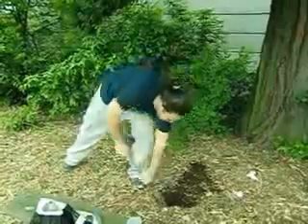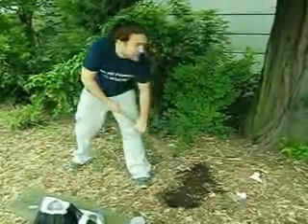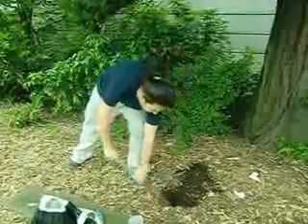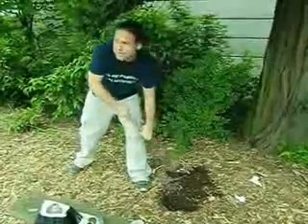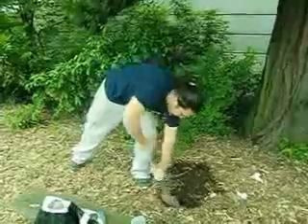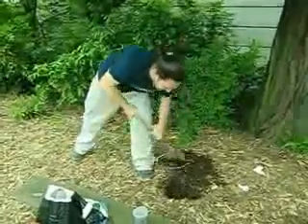So are we doing this in separate sites? We'll probably do it around the same site, just so we're consistent. We don't have to keep analyzing for different situations. Hopefully the grounds crew don't come and castigate us or something. Ah, man, this is hard. It's harder than I remember.